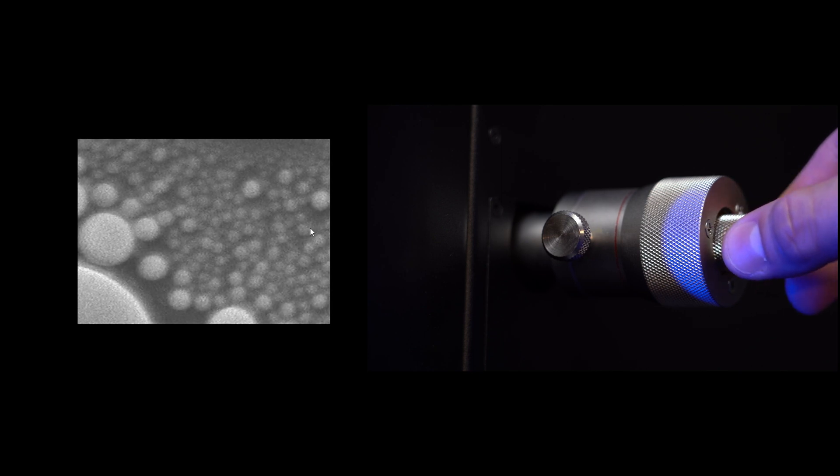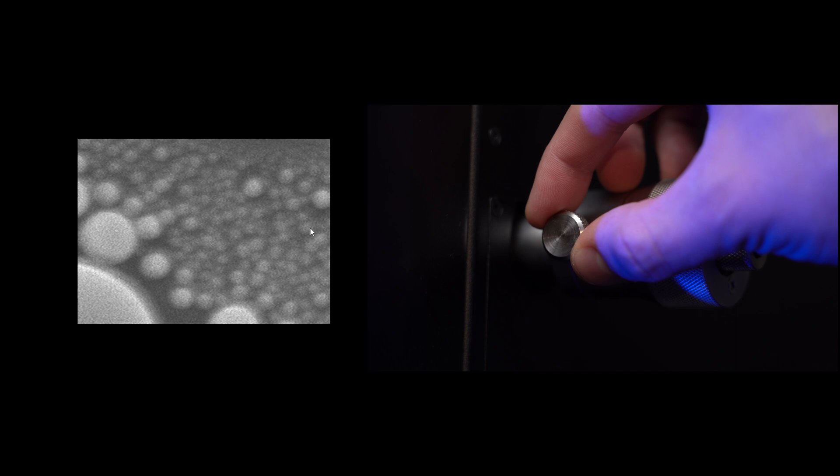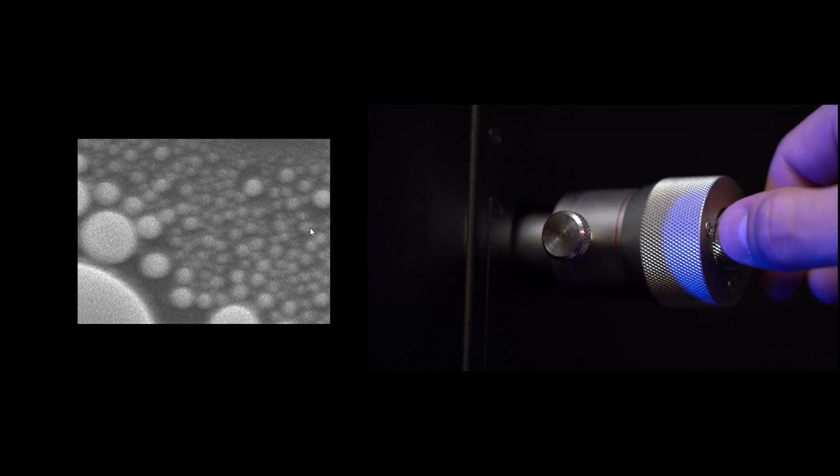Let's adjust the aperture to get a perfect image without the xy shift. I use manual aperture knob, but some systems have motorized aperture and special wheels on the control panel. Okay, perfect.